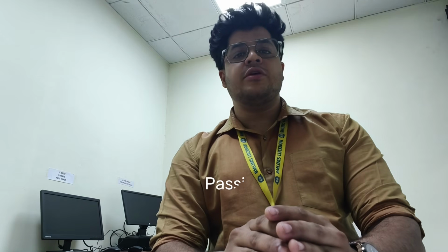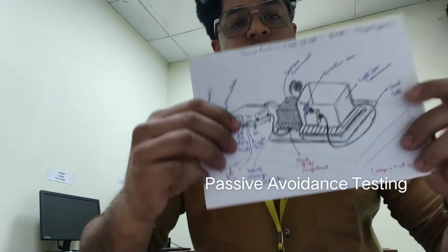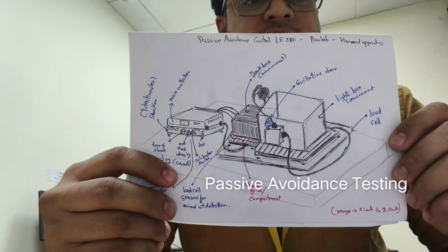I am a third year resident in the Department of Pharmacology, and today in this video we will be discussing a behavioral model used in experimental pharmacology. It is passive avoidance testing. This device is present just behind me.